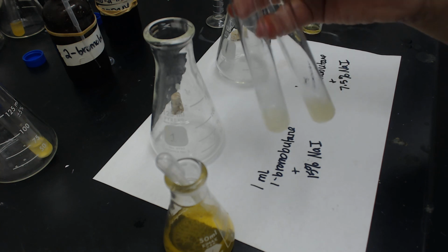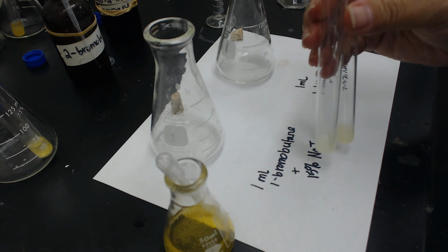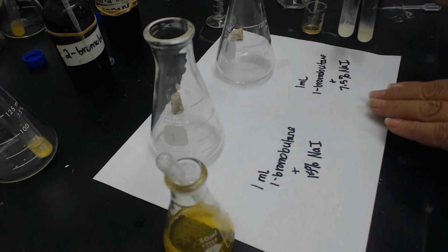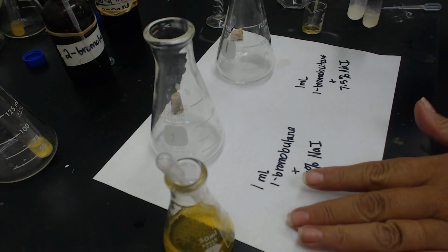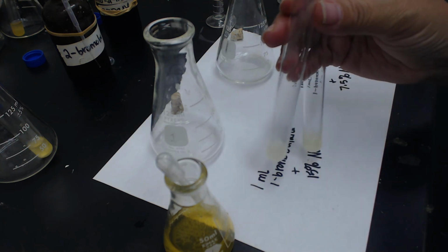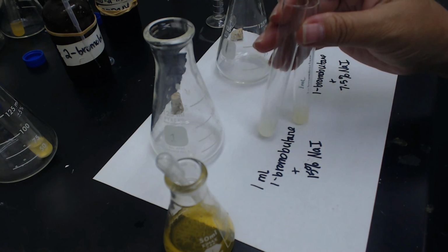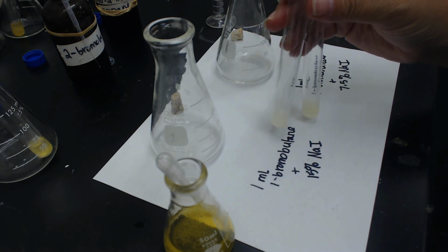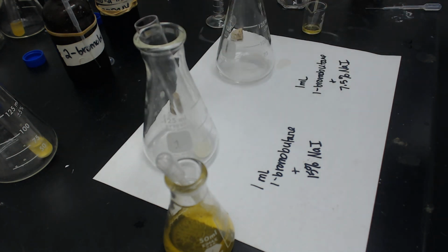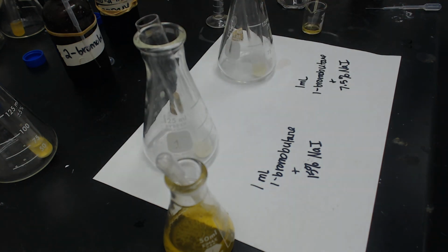So the rate of the reaction seems to also hold. It's not perfect. This isn't the perfect way of measuring it, but again, it seems pretty much that when we doubled the concentration, the rate also doubled. And so that's characteristic of an SN2 reaction. All right, so I'll stop here for part 1. And then there'll be another video for part 2, for part B.